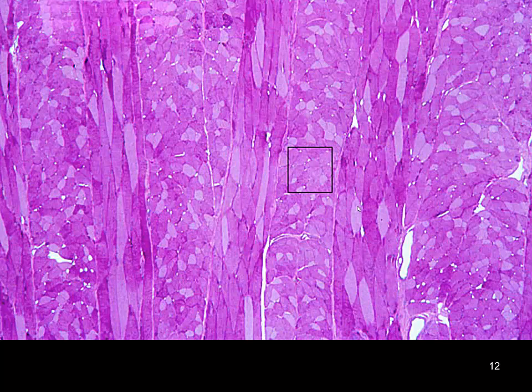Now, I included these. These are just some very interesting cuts. These are kind of oblique, tangential, not along our typical transverse and longitudinal that we're looking at, and some of these muscle fibers and bundles are running parallel to each other, and some are running perpendicular to each other. But it just makes for a really interesting looking and almost artistic section through skeletal muscle. This is not one you'll see on a quiz from me, but I just want to include it because I just thought it looked really cool.